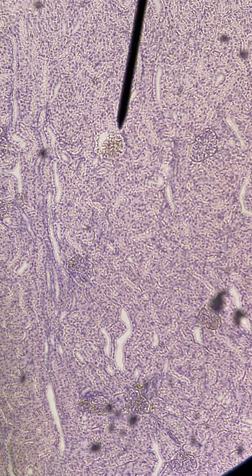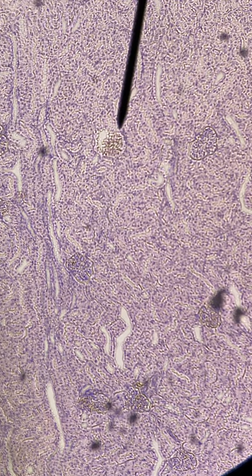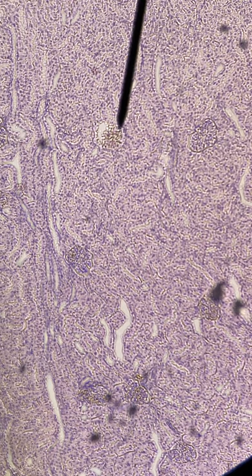This one up here I think was maybe my best option. This big gap right there — this one's been kind of blown open — but you can actually see little blood cells in there too. That's going to be a corpuscle, with the outer bit being the capsule.